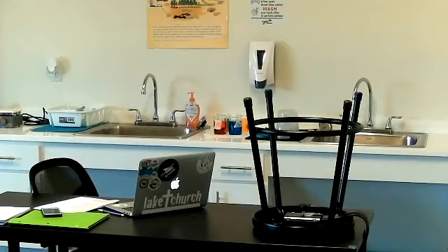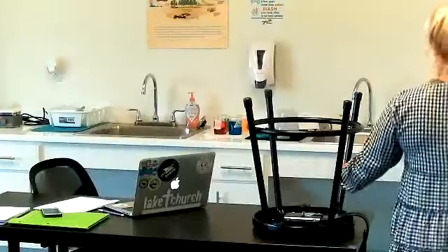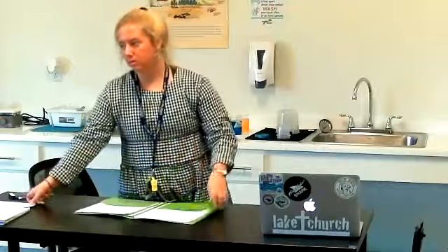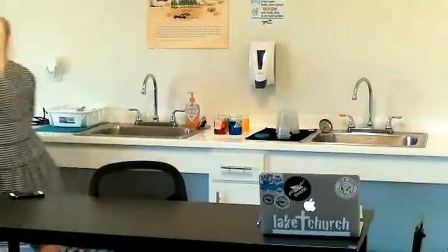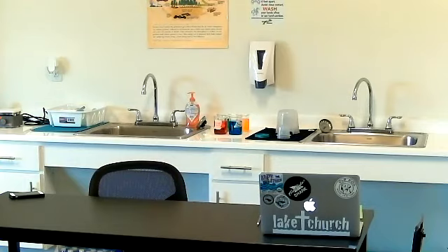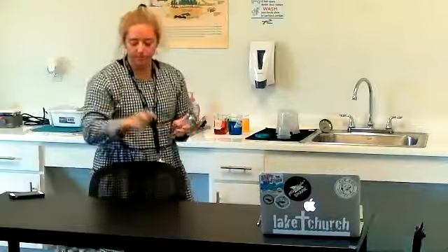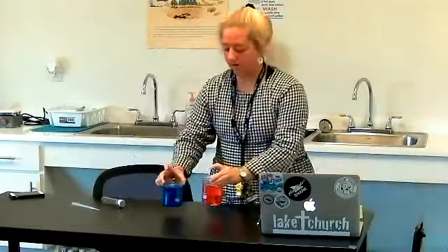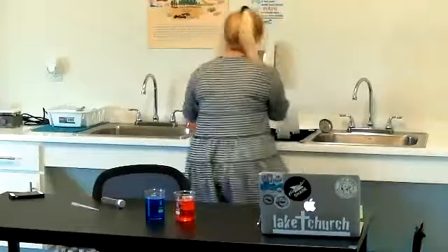Hi guys, welcome to our lab today. Give me a second to get set up. If you have the supplies to do this lab at home, you're more than welcome to. It's not hard to do: food coloring, a clear container — we're going to be using a test tube in class, but if you have something at home that could take its place, kind of skinny, or a larger container, you'll just need to use more liquid. We have a test tube and a pipette, and if you were doing this at home you could carefully add the water yourself.